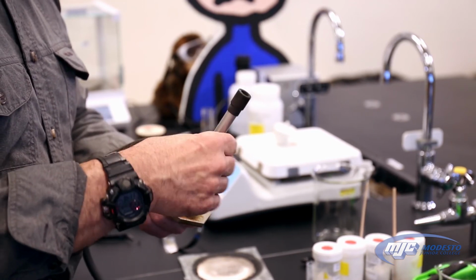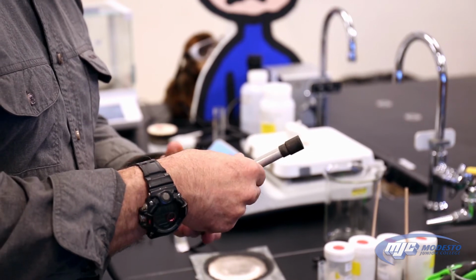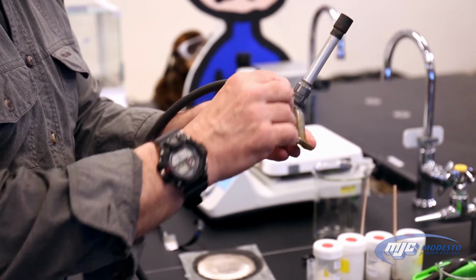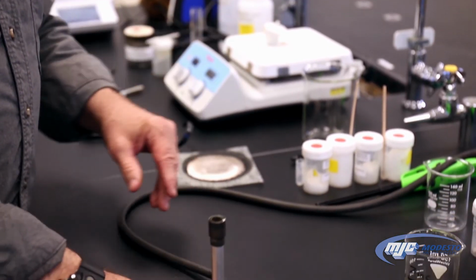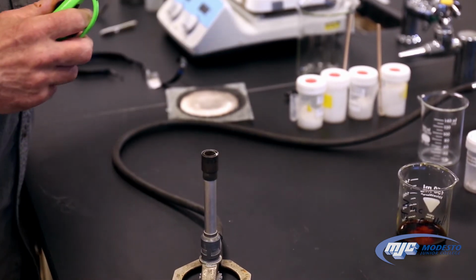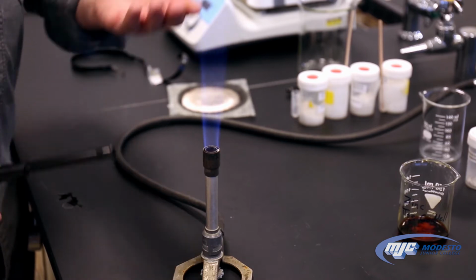So a good starting point is if we have about a millimeter or so between the top of the threads and the bottom of the gap, about like that. So now it's set up to light. So we take whatever we're going to use. You can use a striker, matches, barbecue lighter. Turn on the gas, bring the flame up from the side. Now we have a flame.